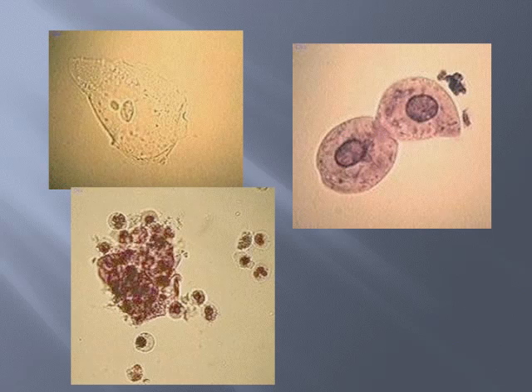Here are some examples. The upper left here is a squamous epithelial cell. They're usually very large. They have a very small nucleus. Sometimes can look somewhat granular, either debris is inside them or laying on top of them. Oftentimes you'll find squamous epithelial cells in sheets, all clumped together there.